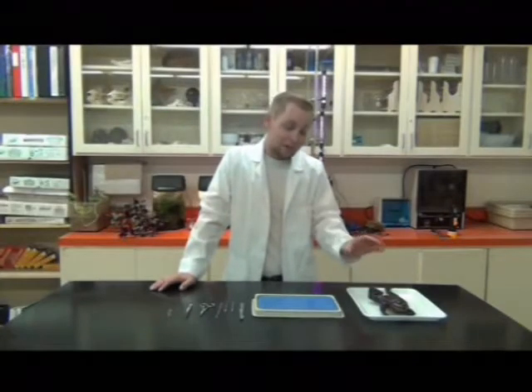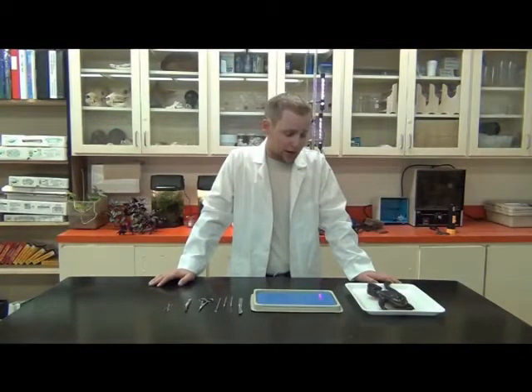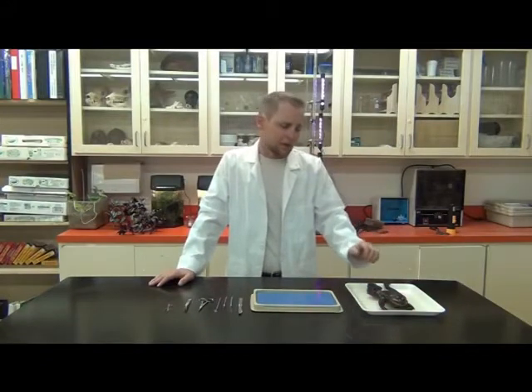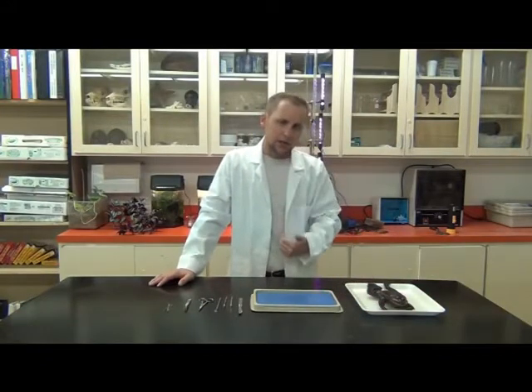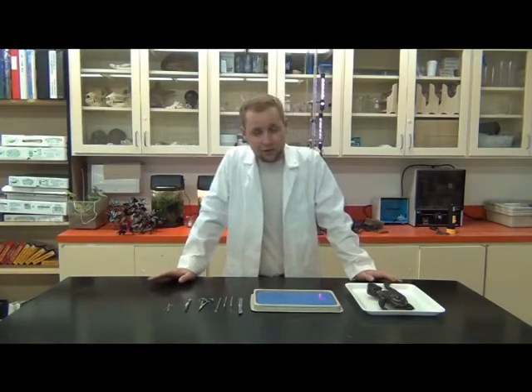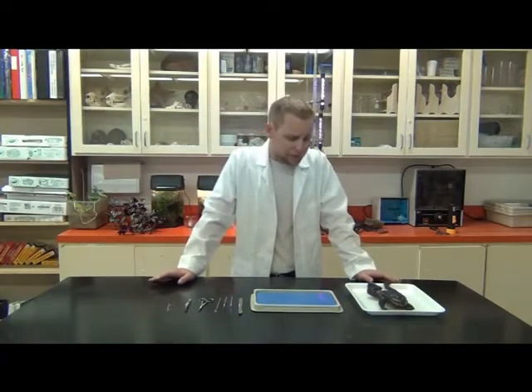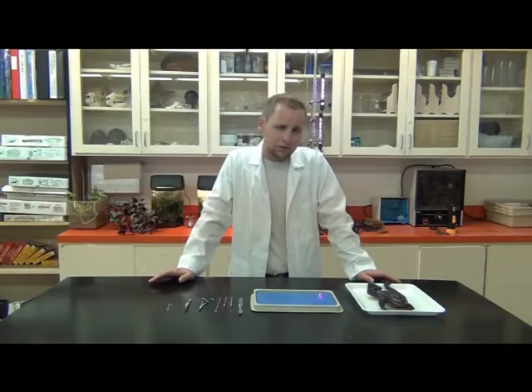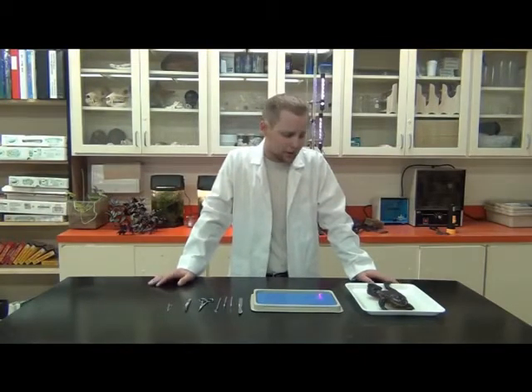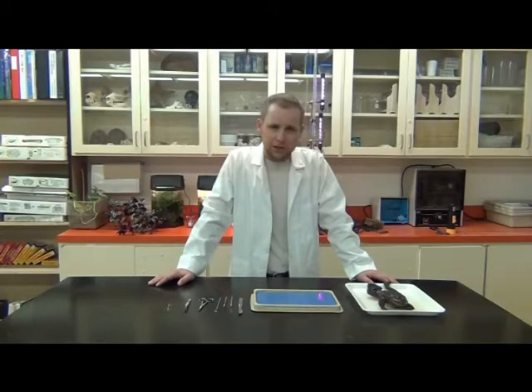Today we're going to go over a very basic dissection of a bullfrog. We'll be looking at some of the external anatomy, opening up the mouth, eventually cutting into the body cavity and identifying several of the organ systems. This will be an overview — give you a little bit of what to expect whenever you do this in junior high and high school, and an intro to dissections.